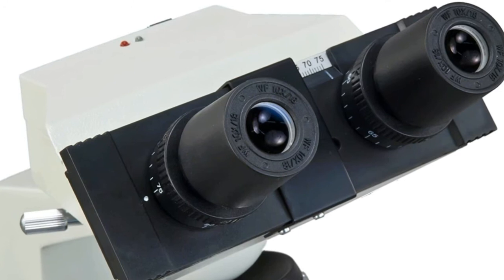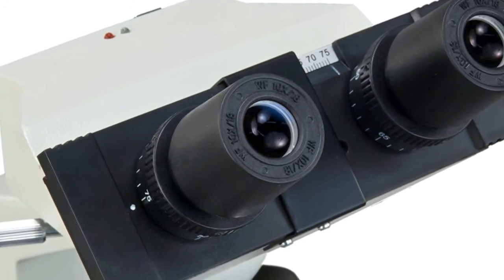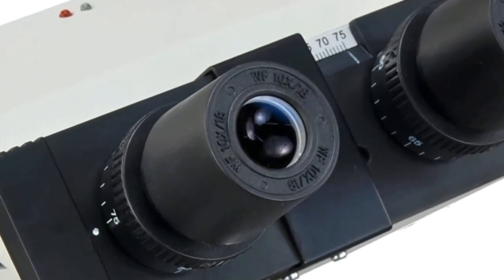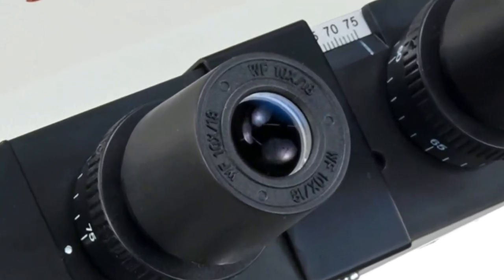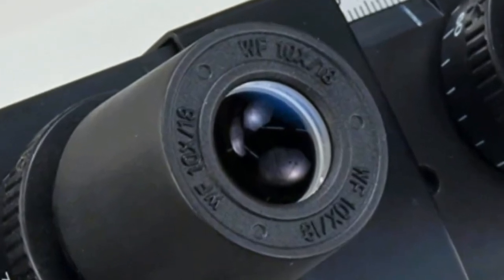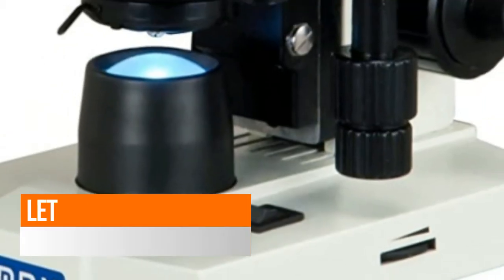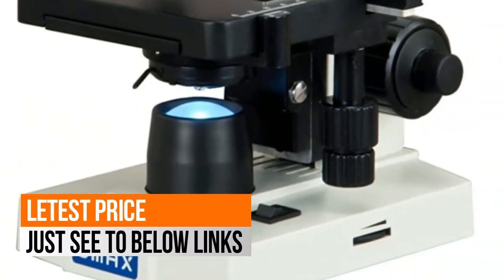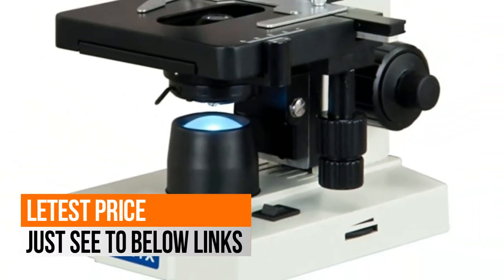Stage upward moving lock protects objectives and slides. Stain resistant double layer mechanical stage. NA 1.25 Abbe condenser with iris diaphragm and filters.